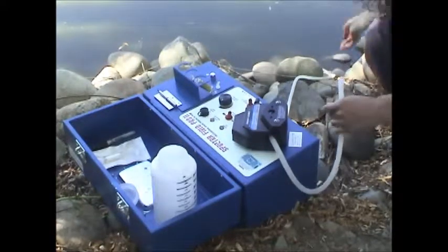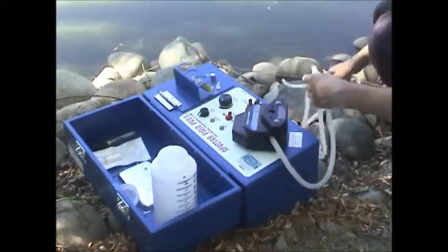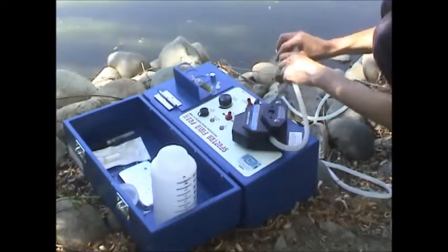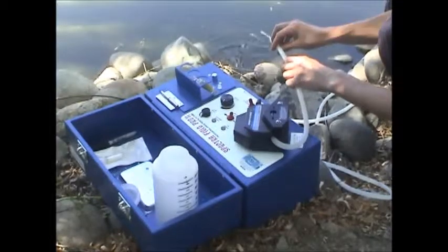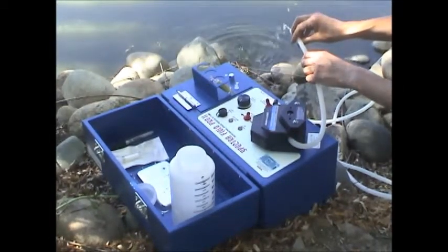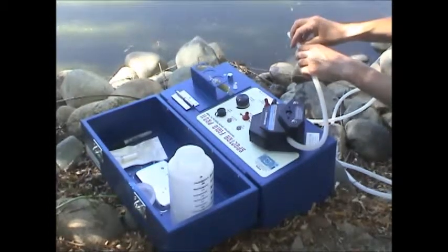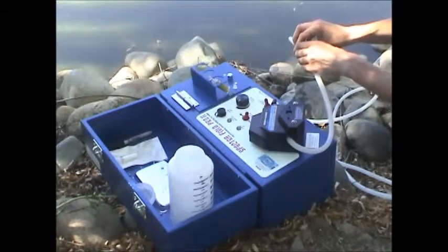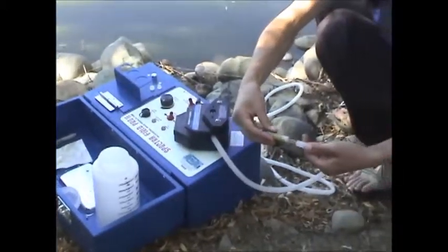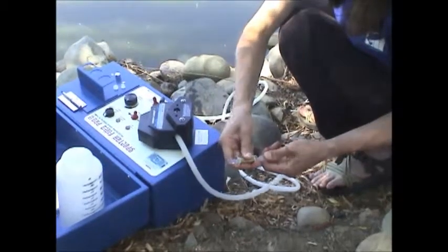For storage and transport, we're going to want to dry that column out. Detach the column, then turn the pump back on and run that tube dry. Once you get all the water out of that line, you can hook the column back up. You can just leave the pump running as well through this — hook the column back up and evacuate the last bit of water.